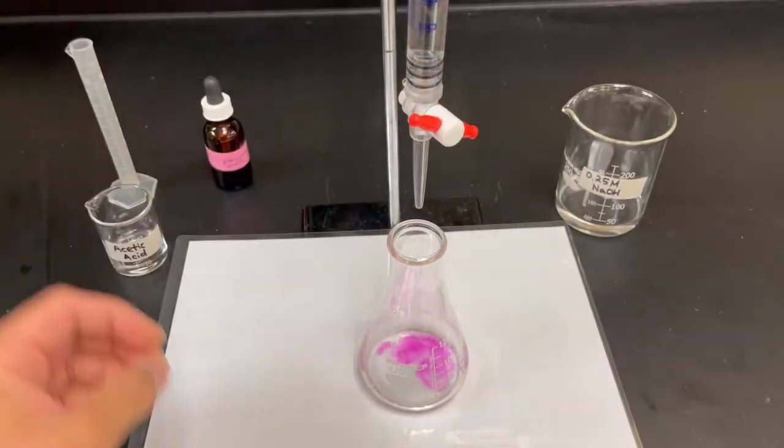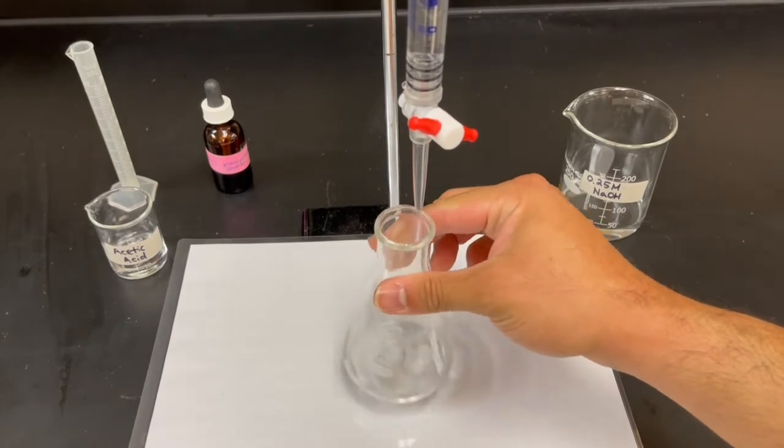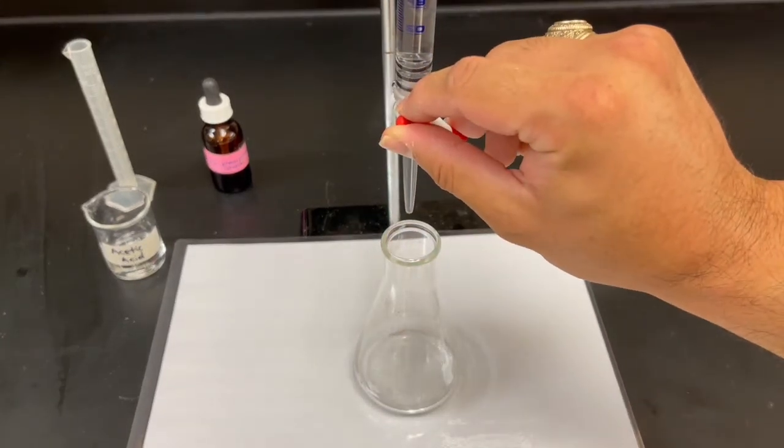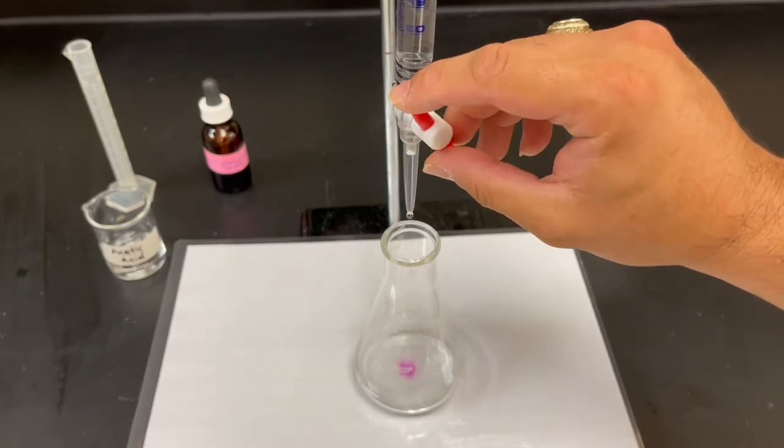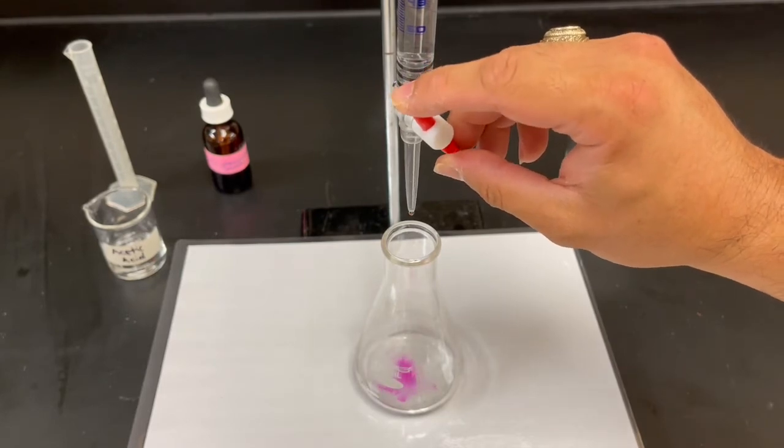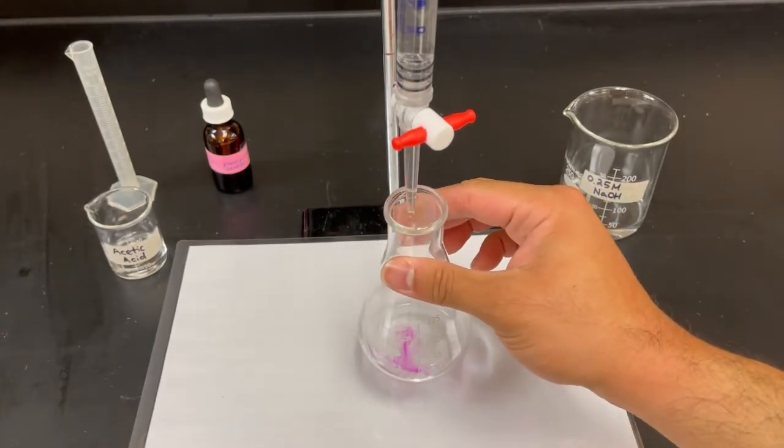And that was one. It should appear and then disappear. Okay. And then I'm going to release it again. That's two milliliters.